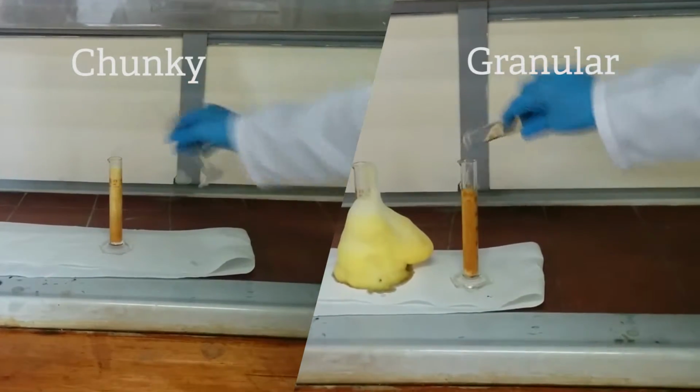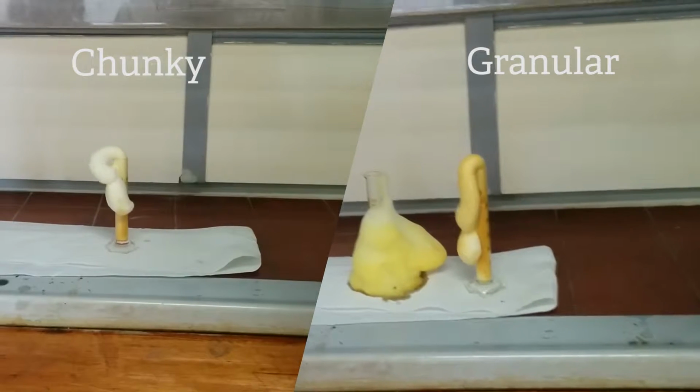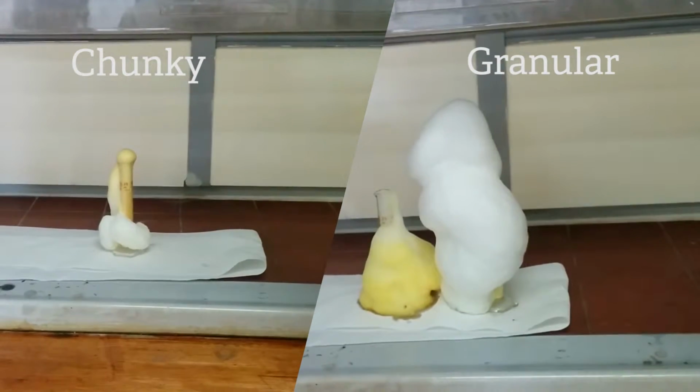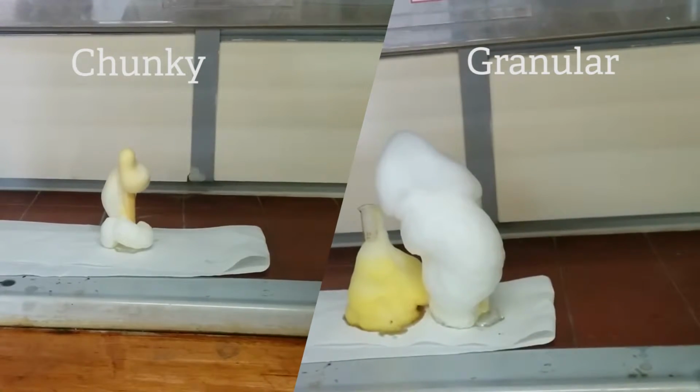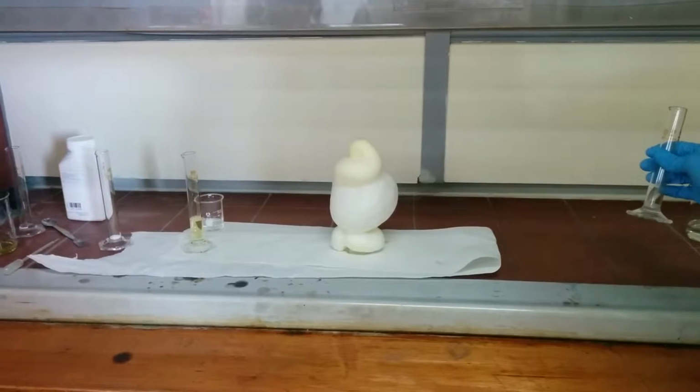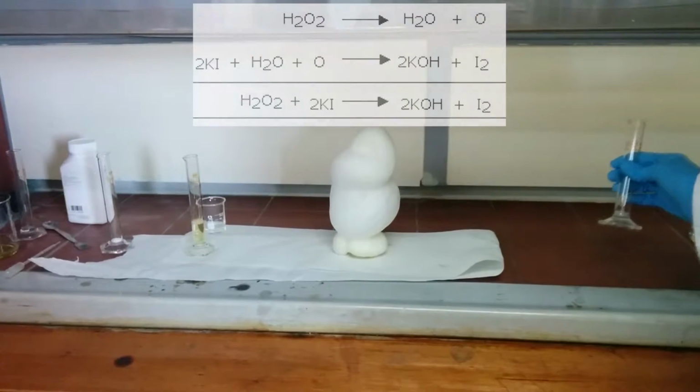As shown in the video of the two tests, with the only differing variable being the surface area of the catalyst, potassium iodide, the powder form of potassium iodide with the larger surface area has a much more intense reaction as opposed to the first test, in which the potassium iodide is a single chunk with reduced surface area.